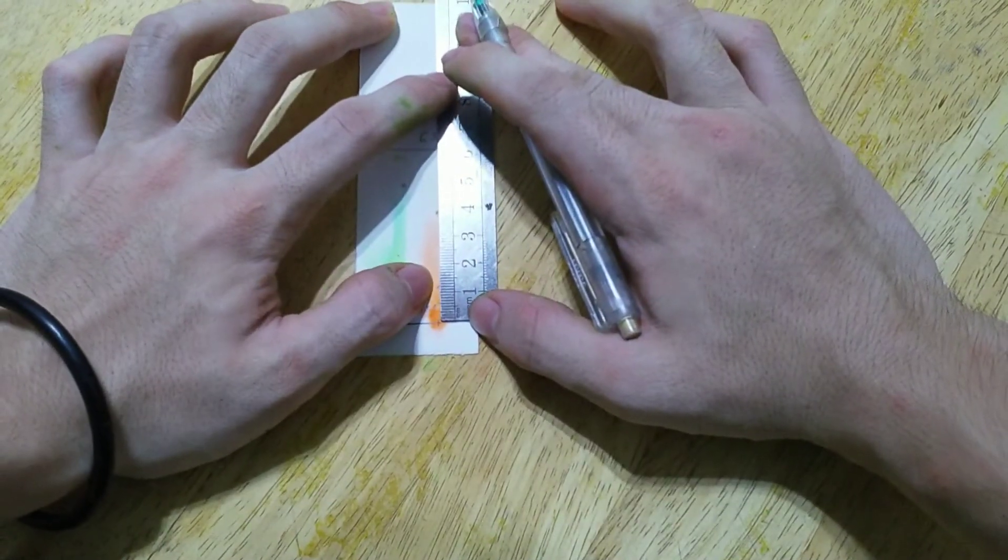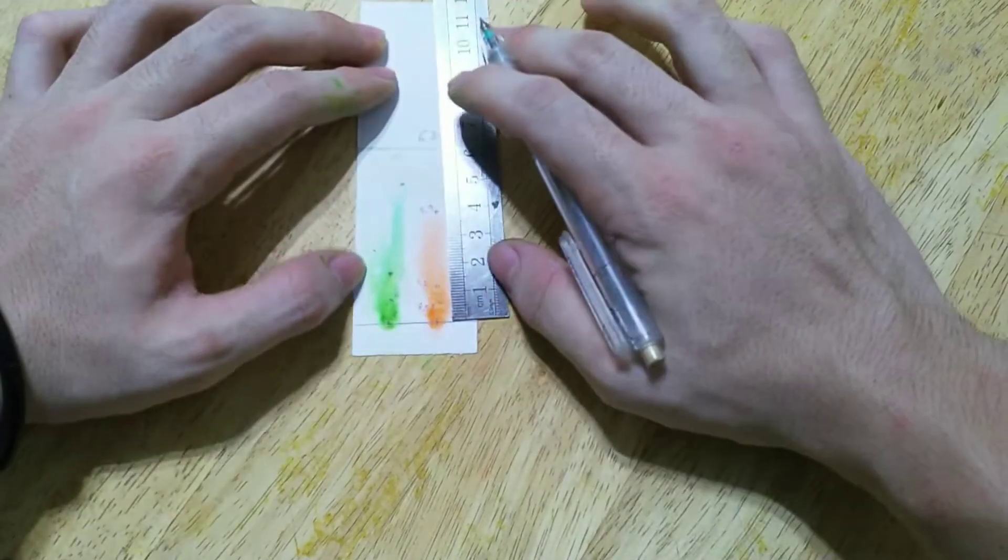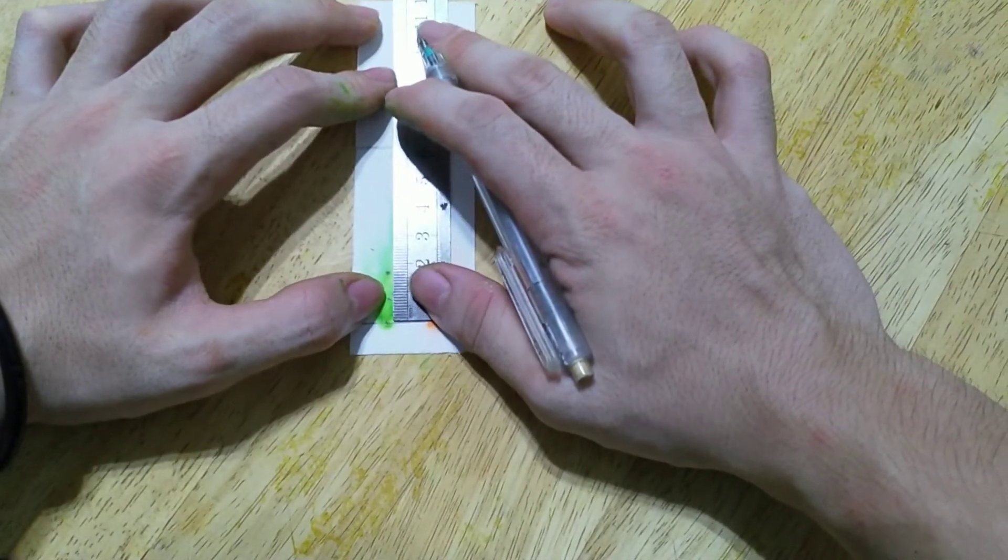And the second is 1.2cm and this is 3.9cm and now it's the green color.